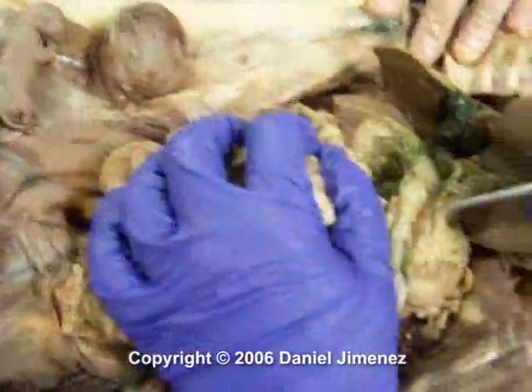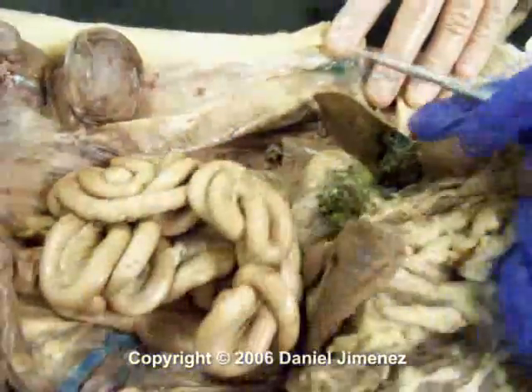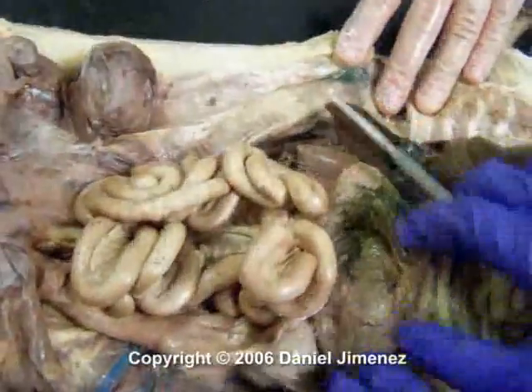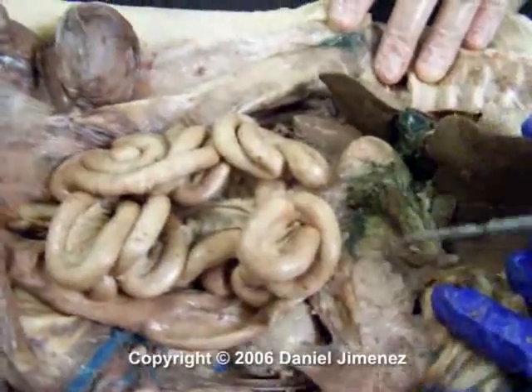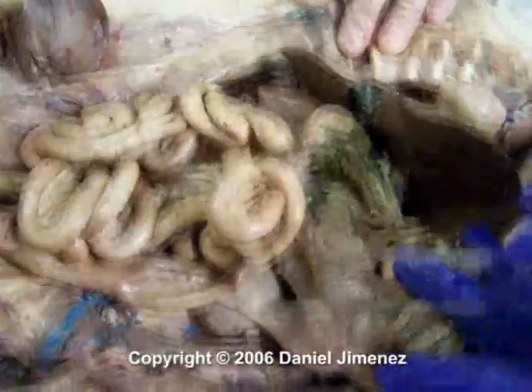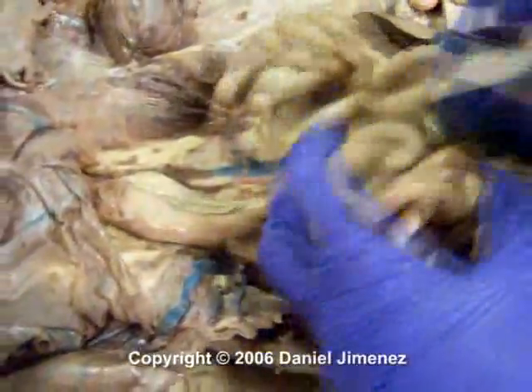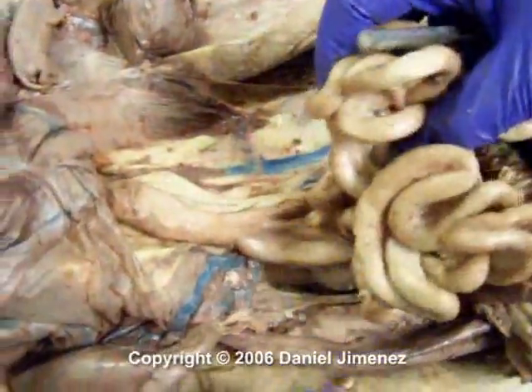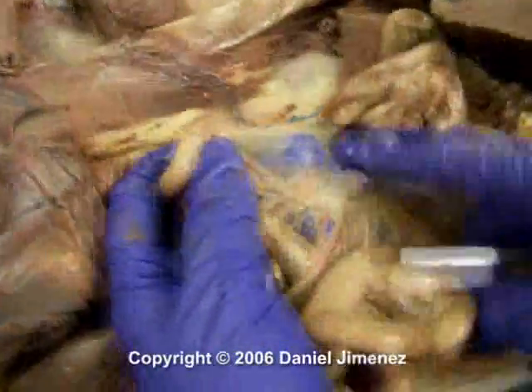Coming off the stomach you have the duodenum. In the curvature of the duodenum you have the head of the pancreas here, and this is the pancreas that extends all the way along underneath the stomach. So that's all pancreas. Follow the duodenum along, it goes underneath. Then you kind of have your jejunum section, and then you have your ileum section of the small intestine. All of this in here is mesentery, holding the small intestine into place.